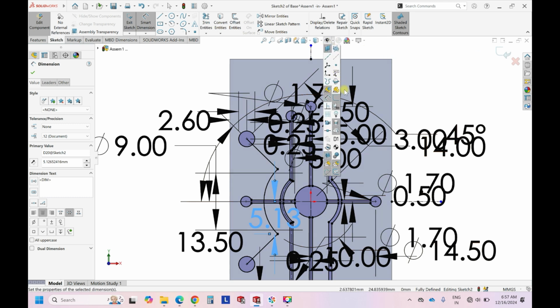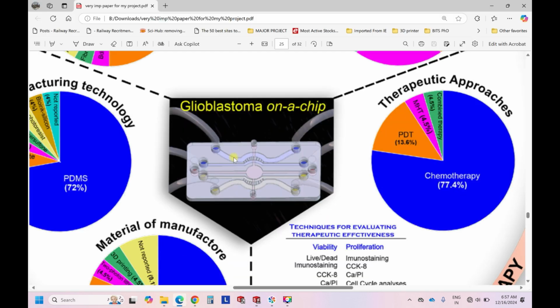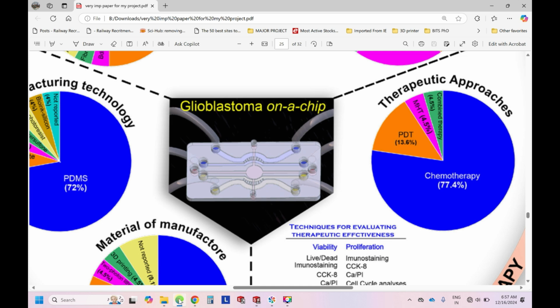But if you see, when compared to the previous design, it is having this curve, right? So for that it's a simple thing, so use this fillet option. So let's make it smaller. Let's try this. Right, so this is working. So we can try to go a little higher if it is working. Yeah, it is working. Right, so 2 mm is sufficient. Use a fillet, or you can decrease the fillet also, depending on the design that you want.